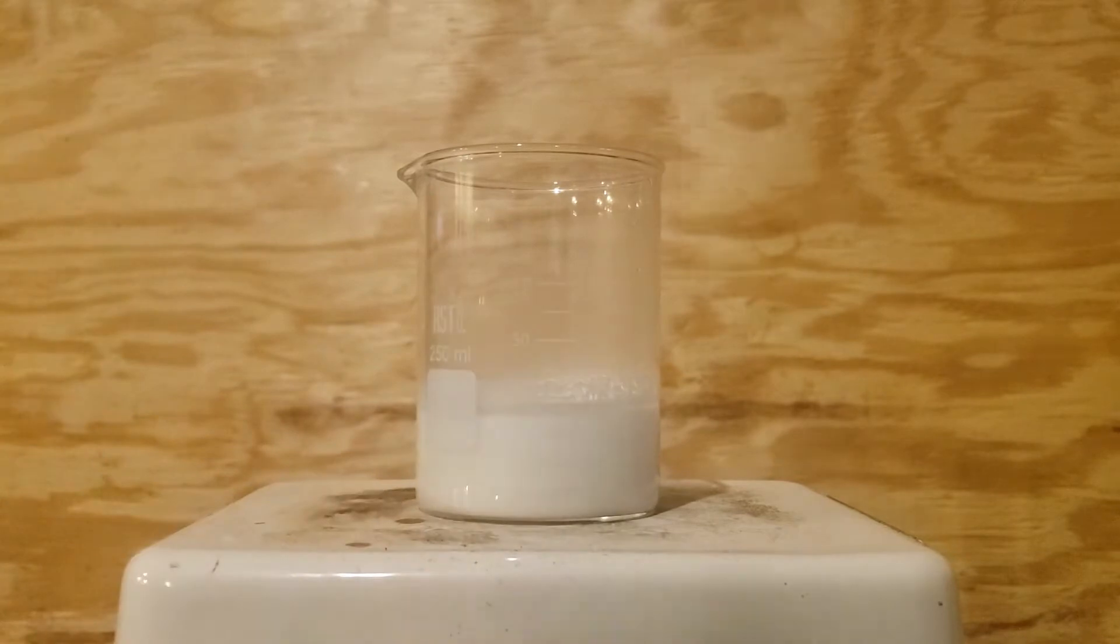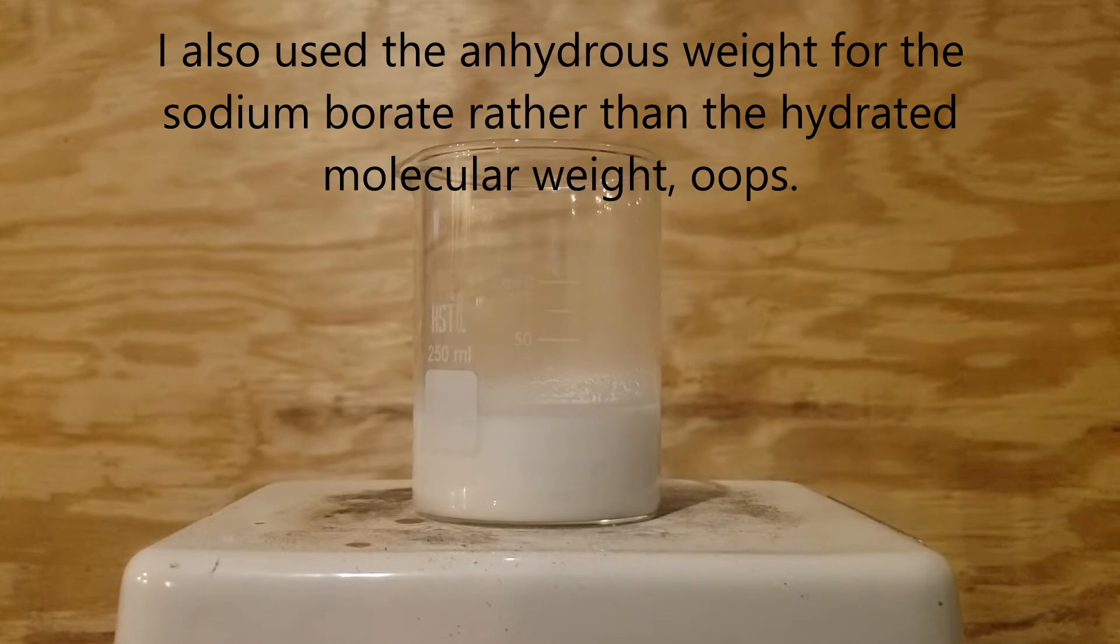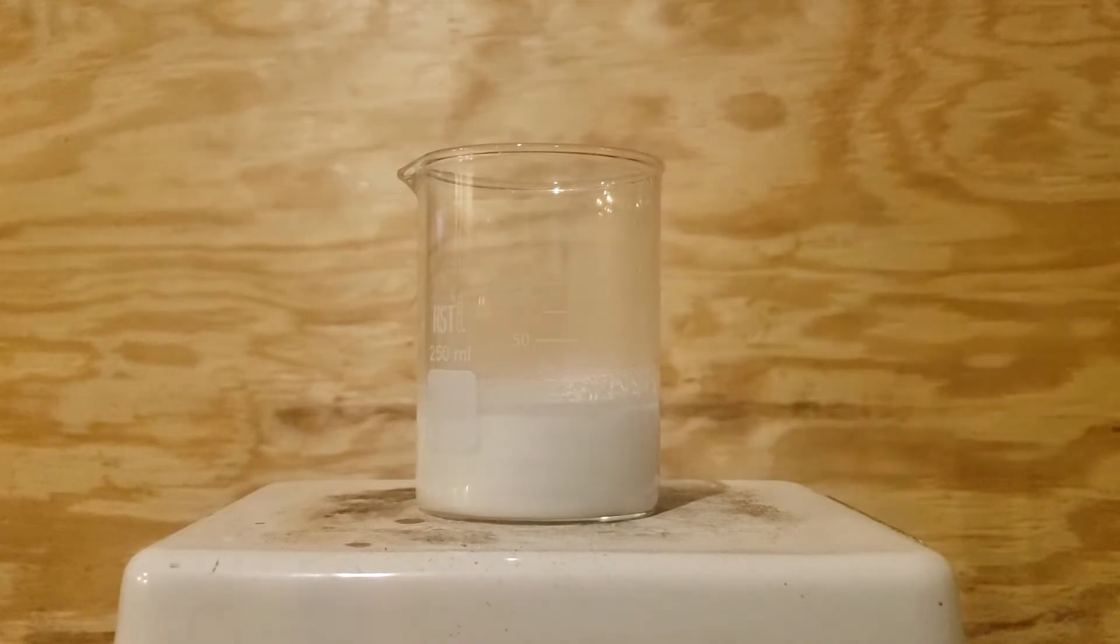However, I did mess up quite a bit on the stoichiometry of it. I partially blame my scale for turning off halfway through measuring the hydrochloric acid, but I also partially blame myself for being too lazy to remeasure it.